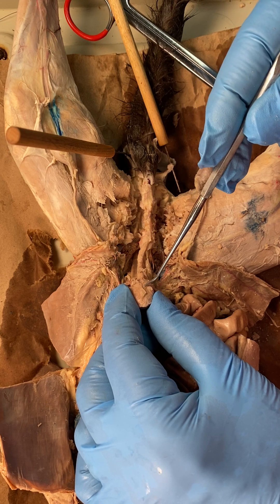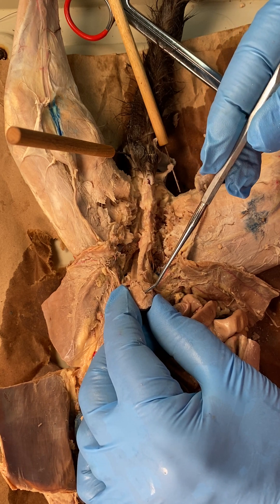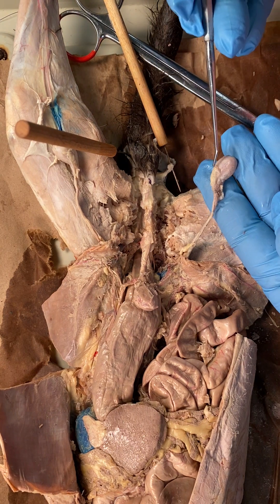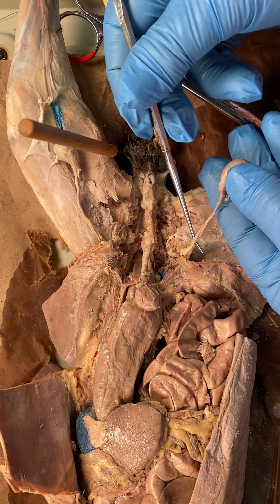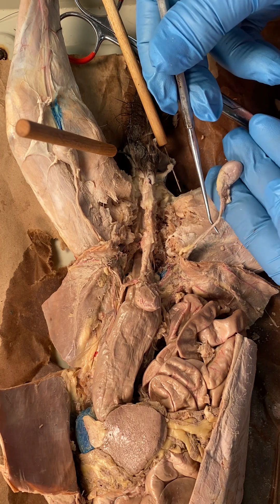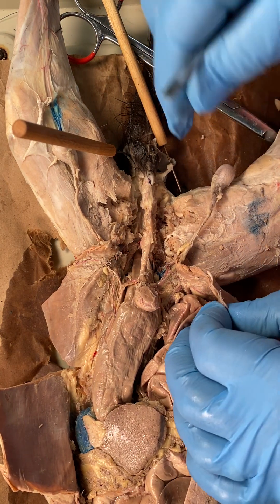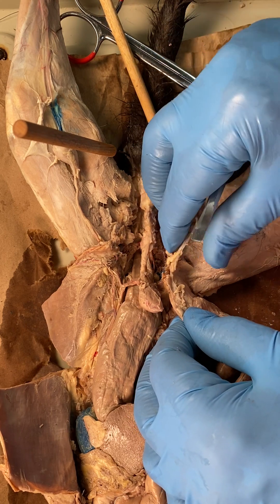The urethra comes out of the urinary bladder. What I'm grabbing up here with my fingers is the urinary bladder. Now let's go back to the testes. This is the right testes, and this is the spermatic cord. The spermatic cord is going to be carrying the sperm, and you'll be learning about that in the lecture part of this class.